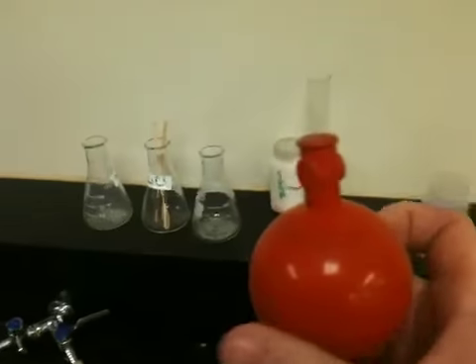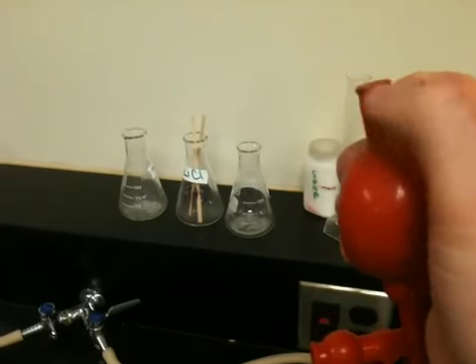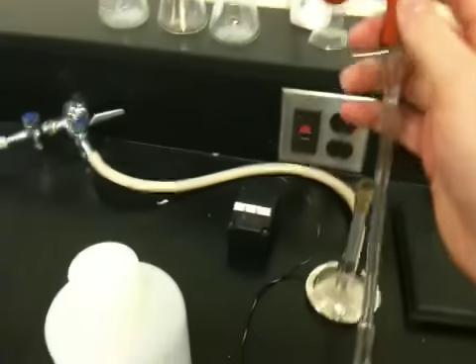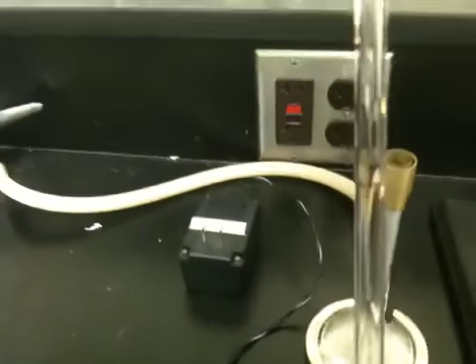I want to get to that line and keep squeezing it. Uh-oh, I ran into a problem. My bulb has already inflated. So to continue drawing up the liquid, I'm going to squeeze the bulb and then push the top valve. Then I can continue my procedure where I'm drawing up the liquid. There it goes, up and up and up. Oh, I went past the line. I don't know if you can see the line there, but I went past it.